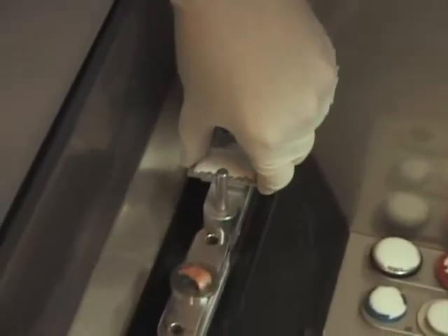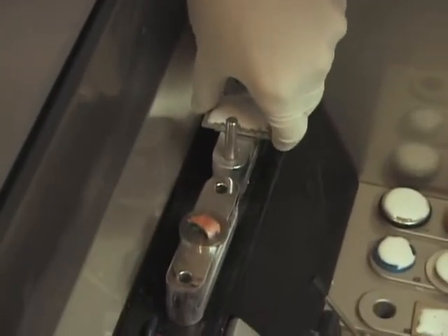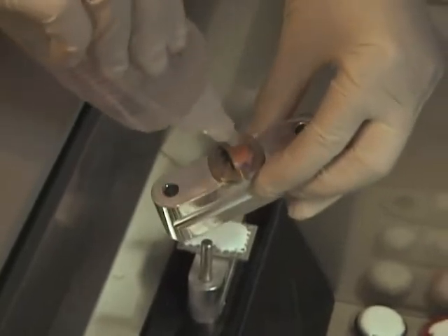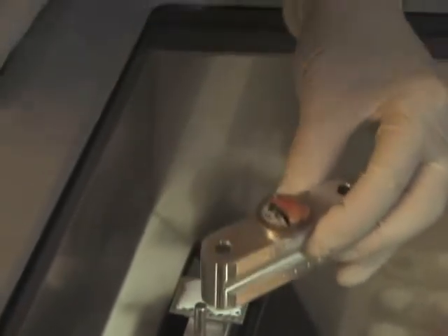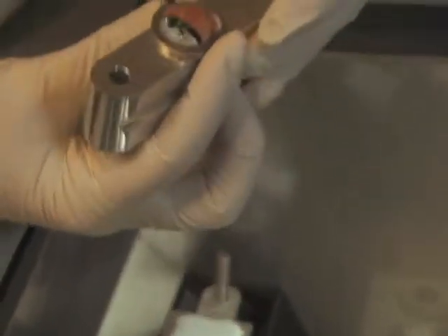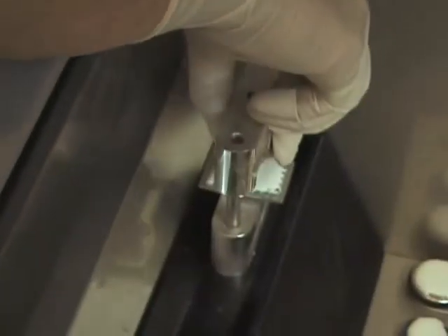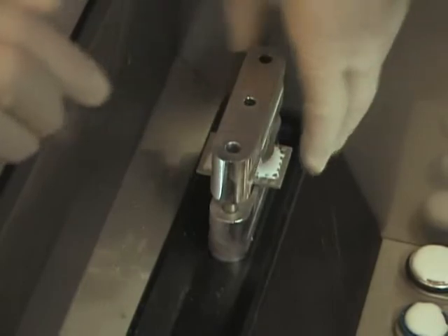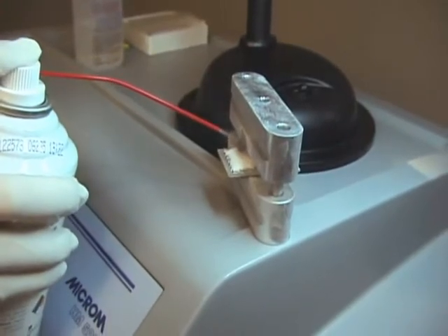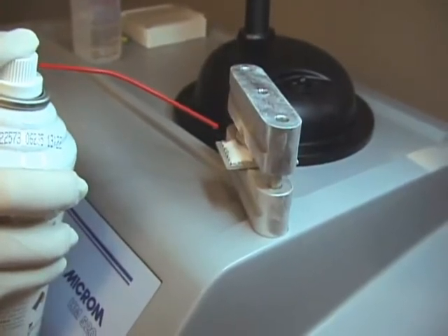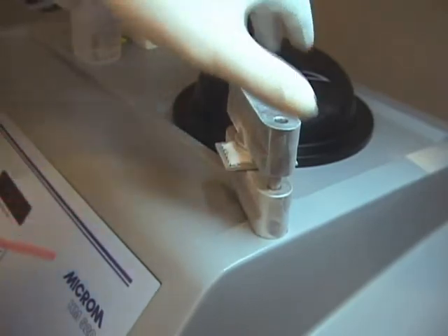Here is the process shown again with the square Shandon chuck. Companies often merge or change names. If the chuck you use is similar to any of these shown, they will work with the cryo-embedder. One great advantage of the cryo-embedder is the ability to remove it from the cryostat chamber. This not only assists with visually witnessing the flatness of the specimen, but also being able to spray the specimen without stirring up harmful airborne pathogens.